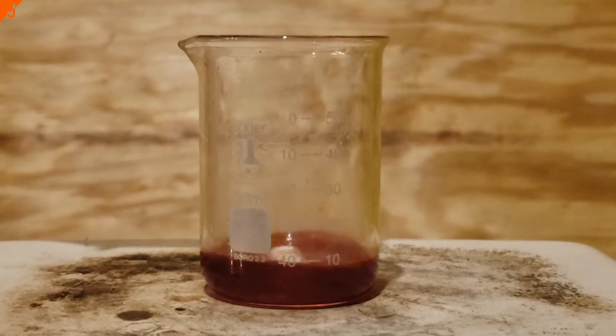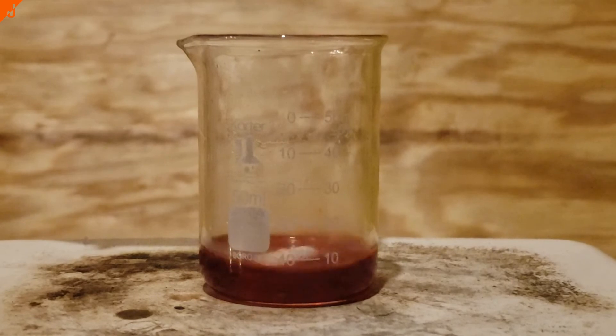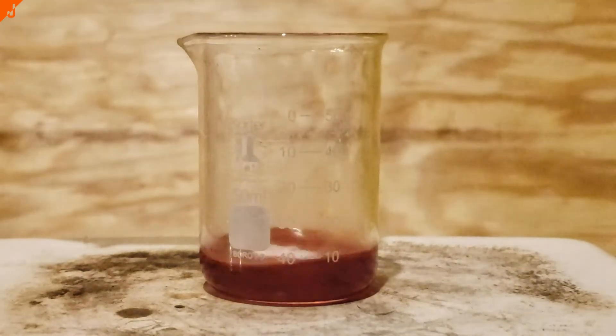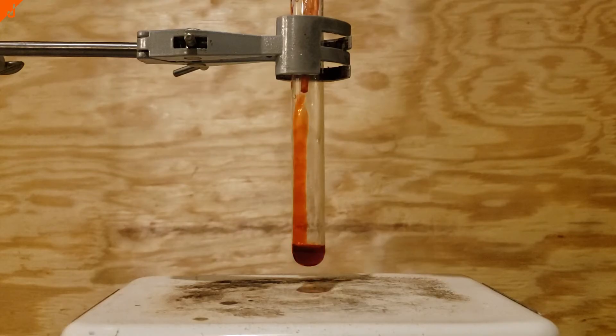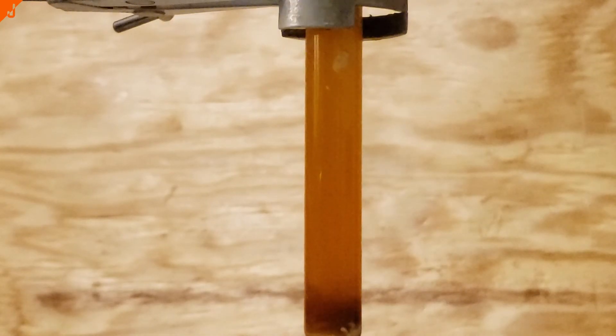Something strange that I observed with this is that, according to the Science Madness wiki, rosocyanin is supposed to form a blue color whenever a strong base is added to it. However, I added multiple different bases to this test tube right here, and you can see nothing seems to happen. And actually, there seems to be this red layer that forms on the bottom of the test tube.